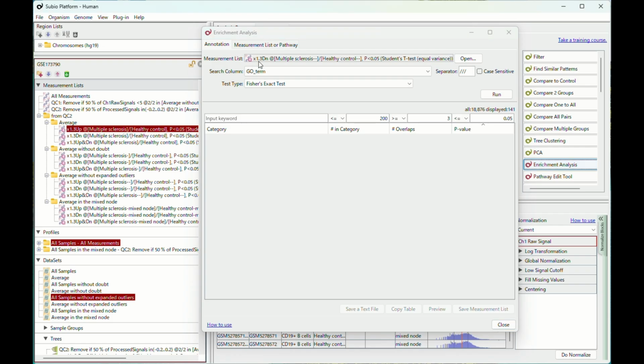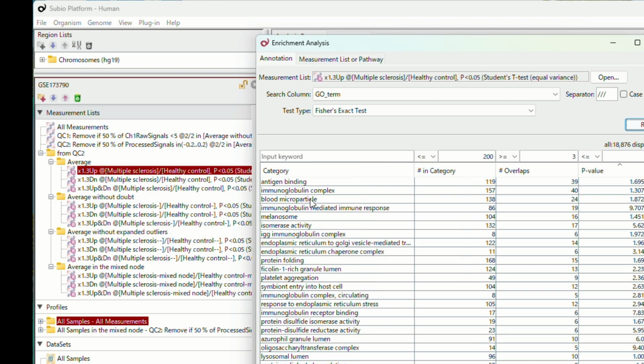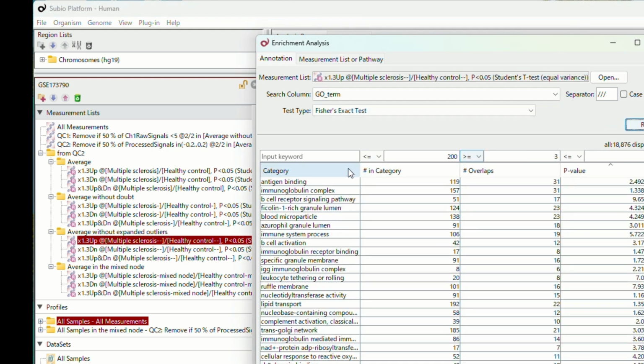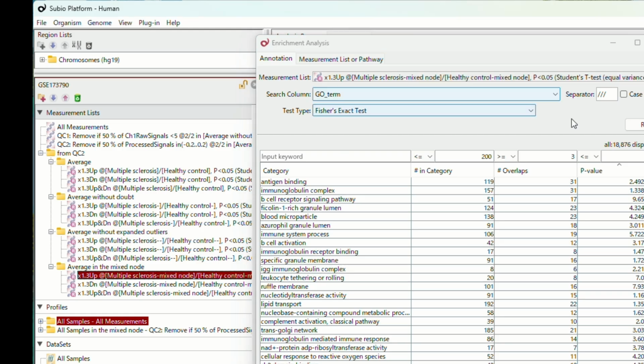The enriched GO terms of the thoughtless version of up-regulated genes include terms related to immune response, which might mask poor analytical processes. The second up-regulated genes, under the assumption that there are true and already MS-like healthy controls, give you terms like B cell activation. The last set of subtly up-regulated genes with no batch effect is T cell activation, along with organelles like the lysosome and the Golgi.